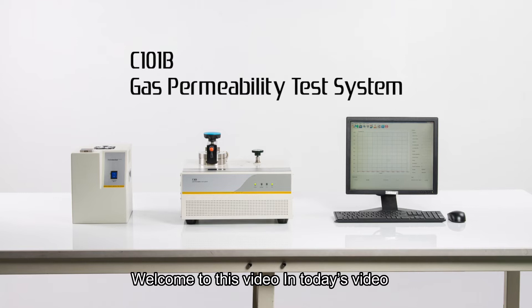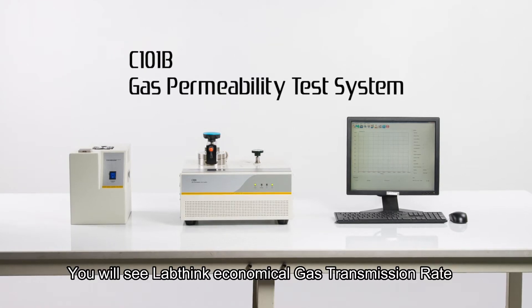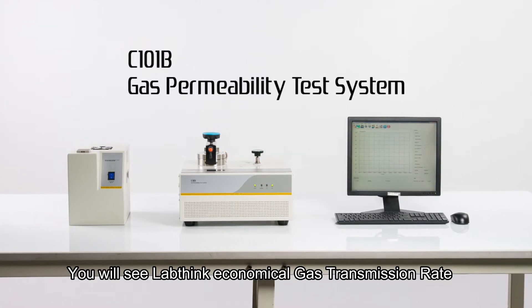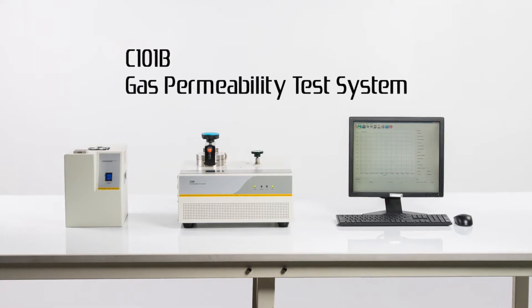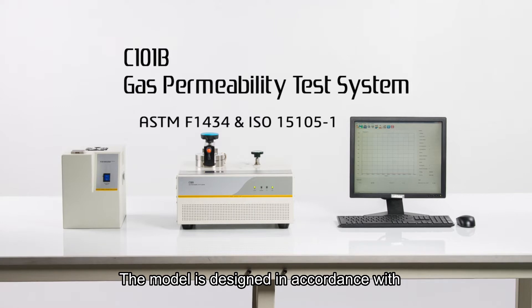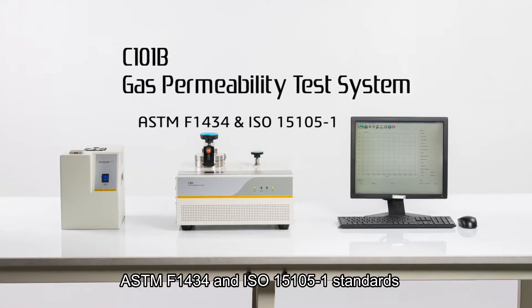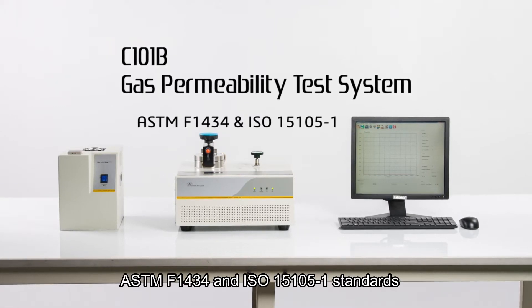Welcome to this video. In today's video, you will see LabThink economical gas transmission rate or GTR testing system C101B. The model is designed in accordance with ASTM F1434 and ISO 15105-1 standards.